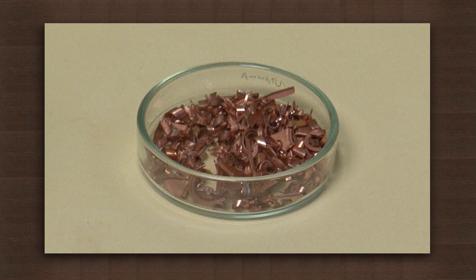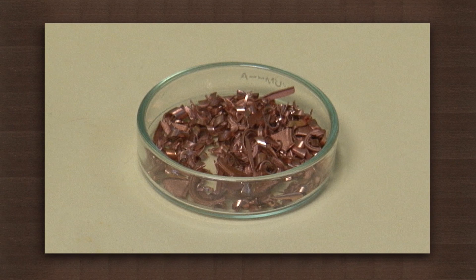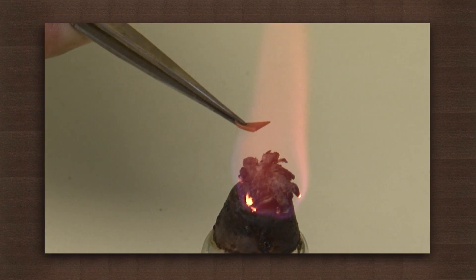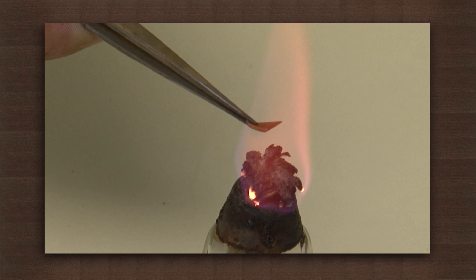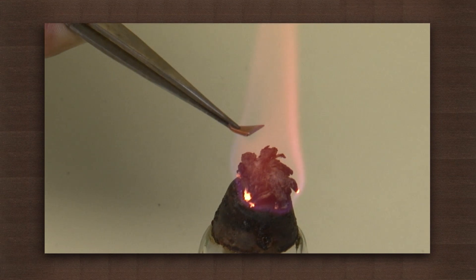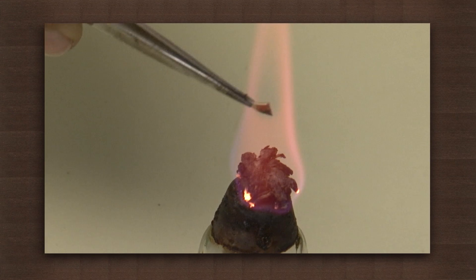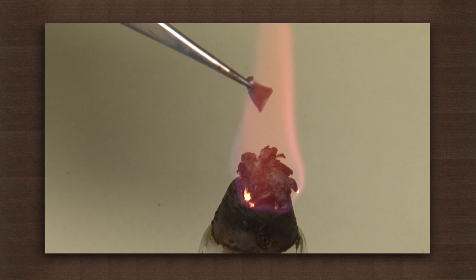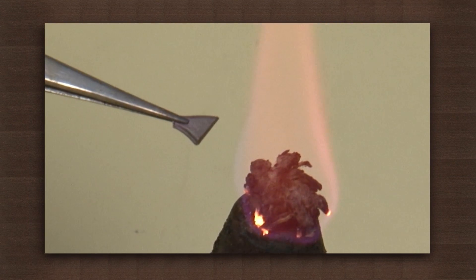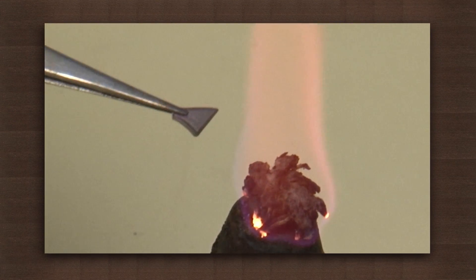Let us try an experiment to see a reaction of a metal with oxygen. For this, you need some copper filings. Take a small piece of copper filing and hold it in the flame. After a few seconds, you see the shiny copper becomes black. This black substance is copper oxide.